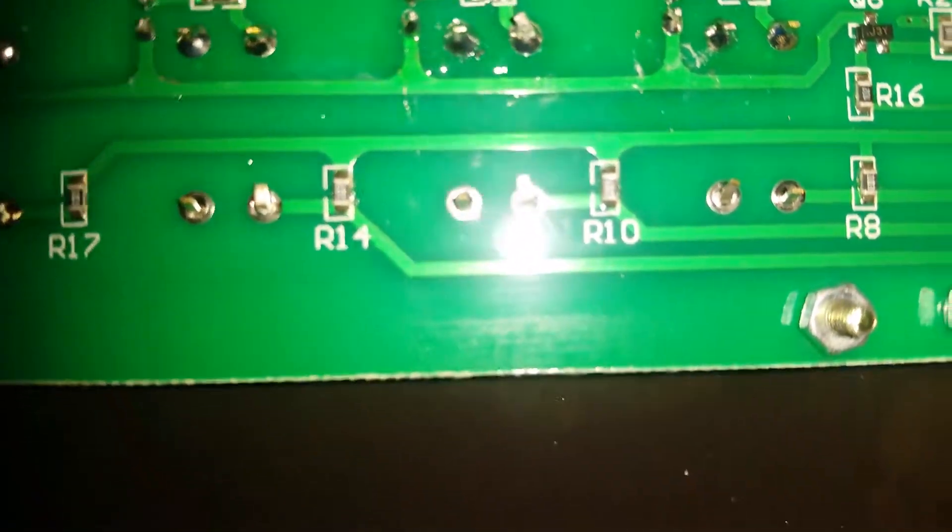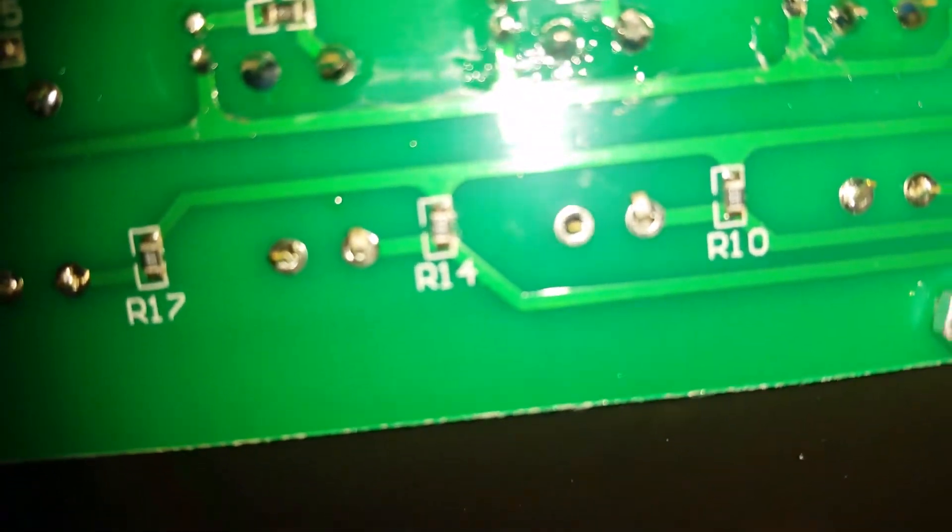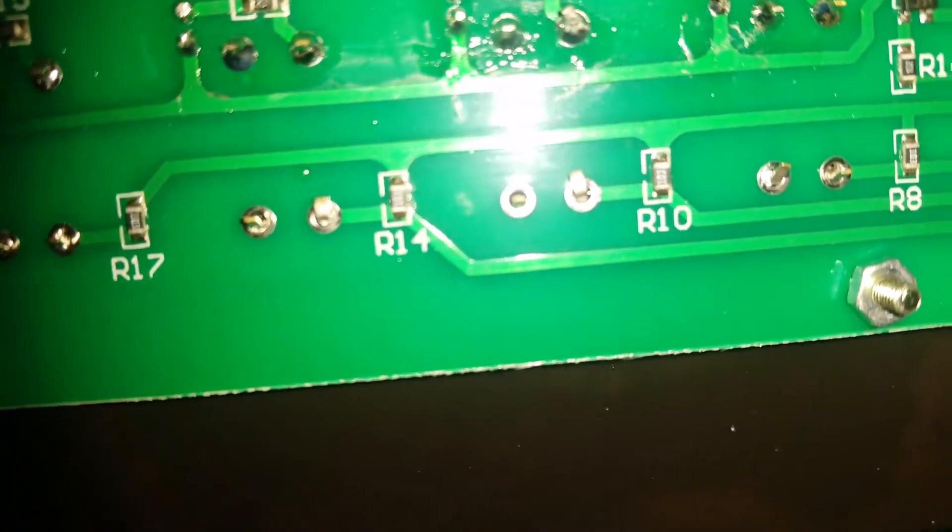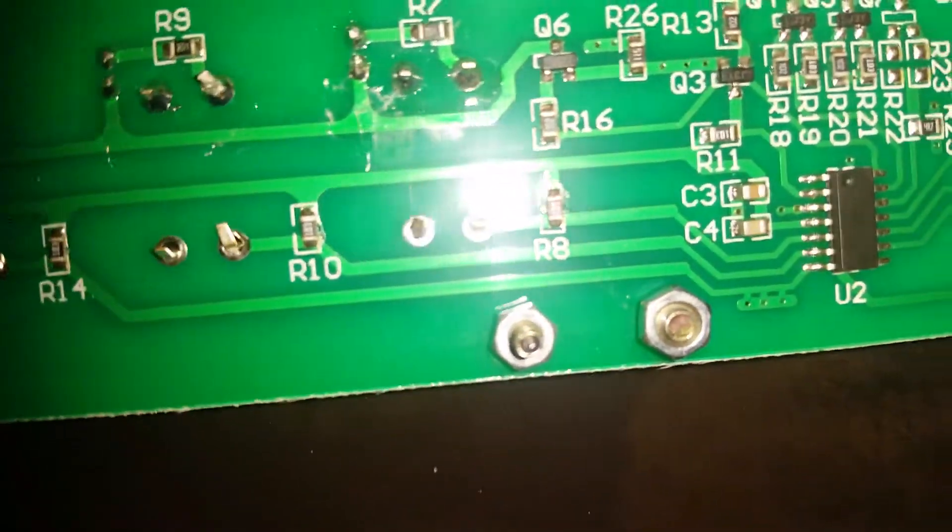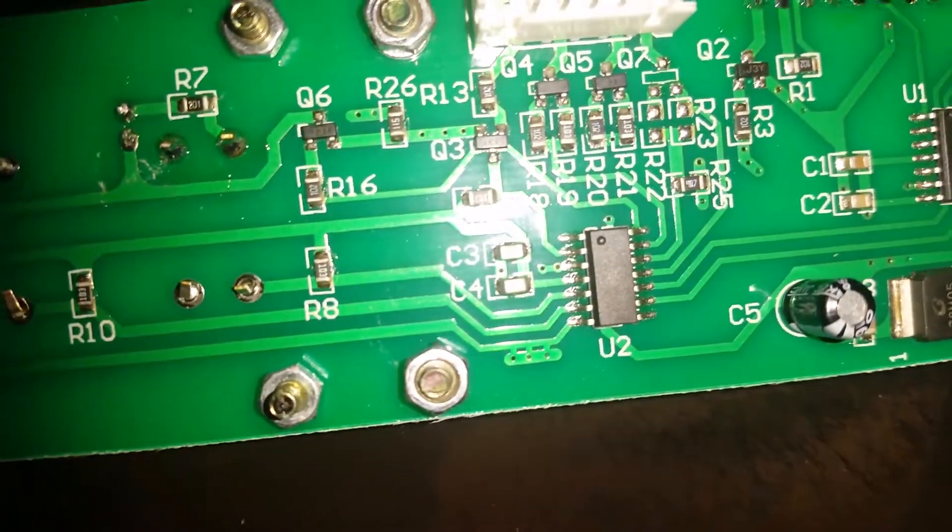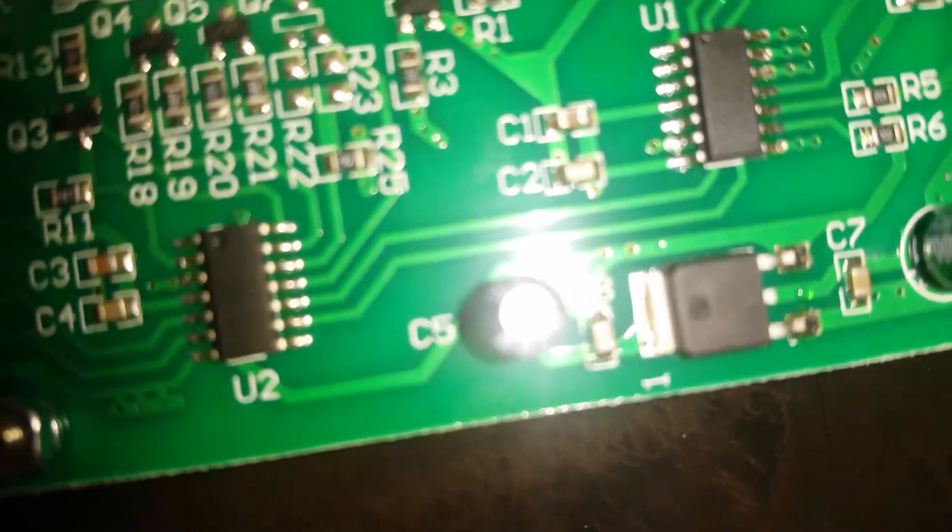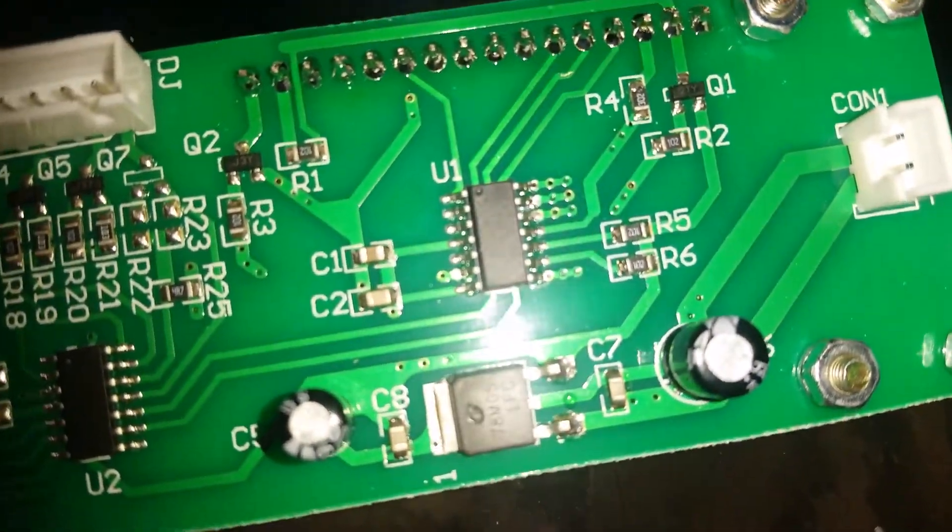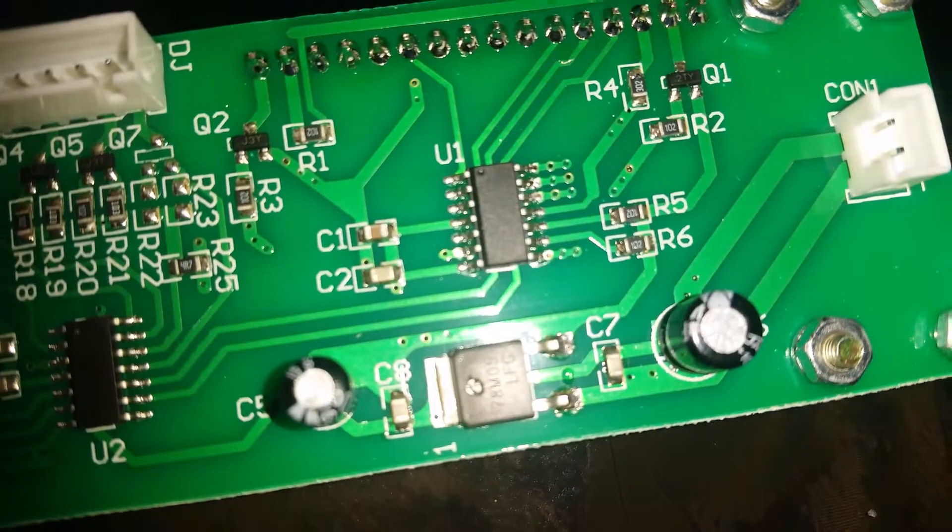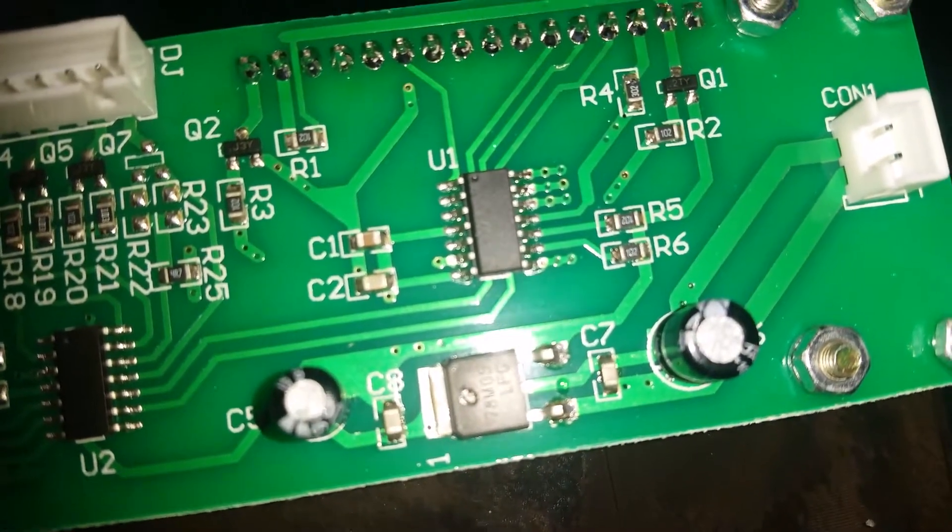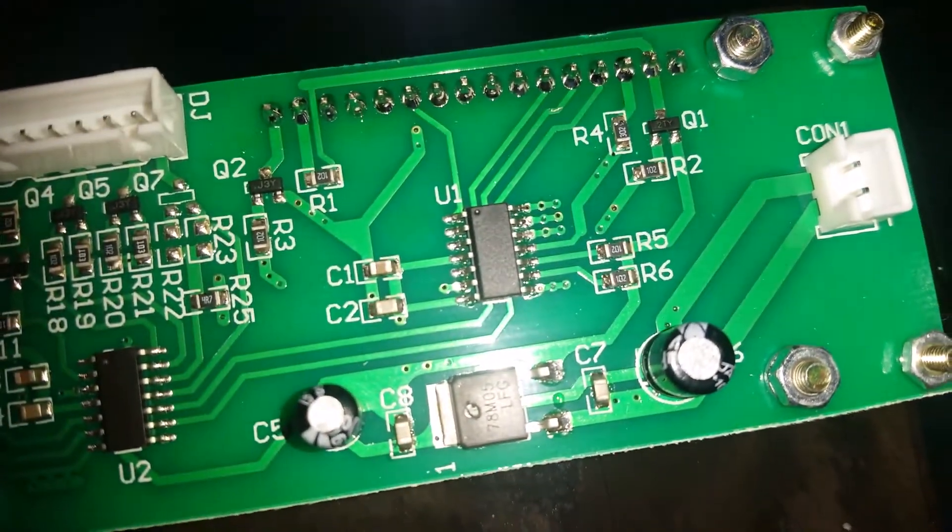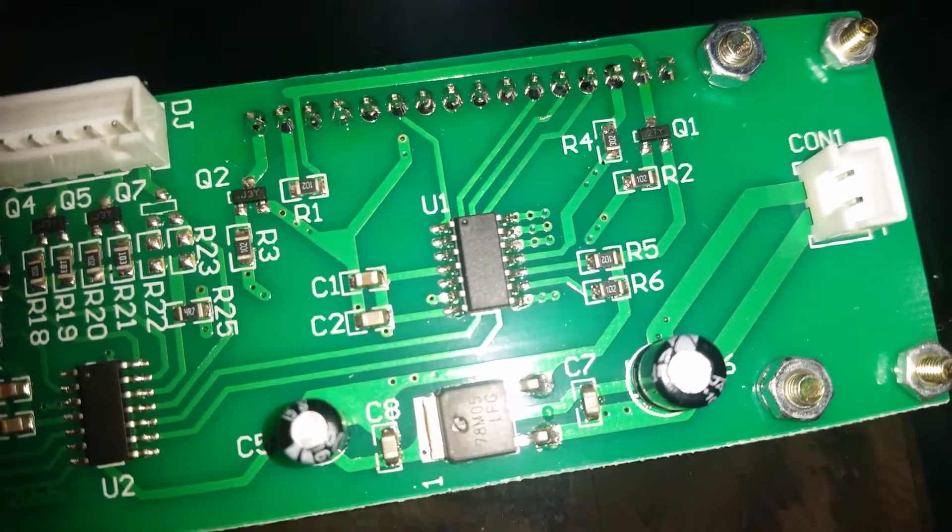That is just poor shoddy solder work. So I'm going to try to fix this solder work and hopefully that will solve my problems. Seems like one of these resistors. Oh yeah, look at that circuit board. That number two pin. It's not soldered all the way.